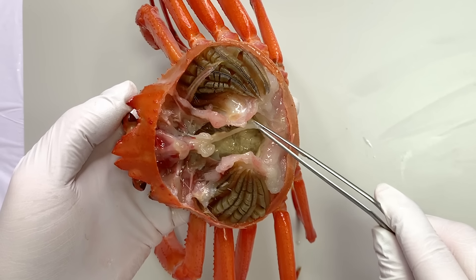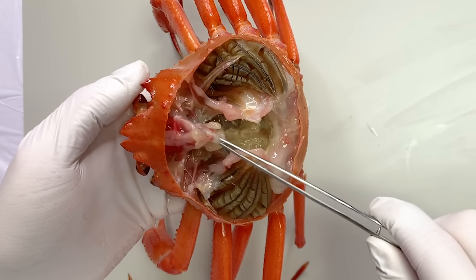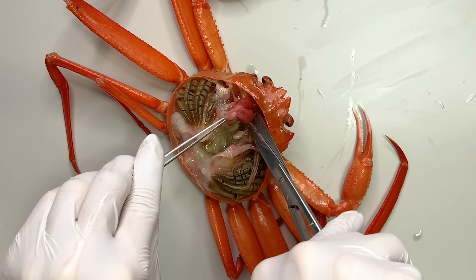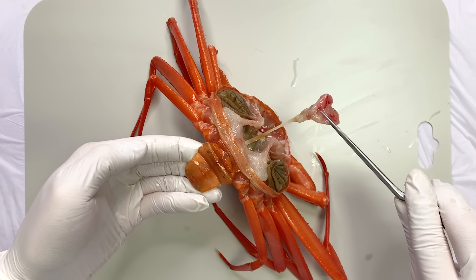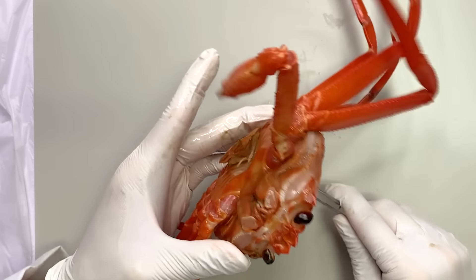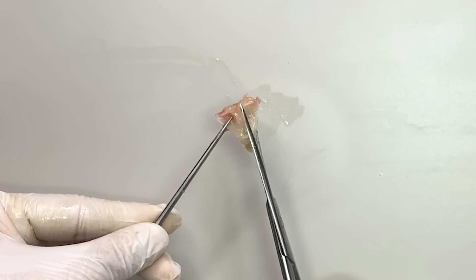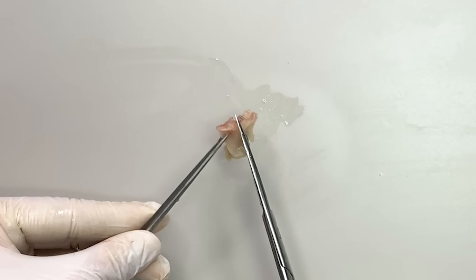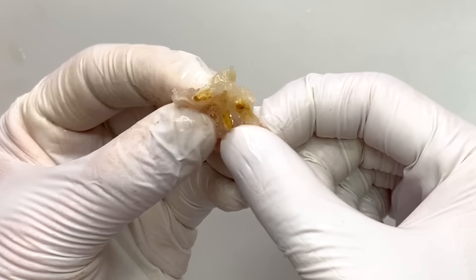This part is the crab's intestines. And this is the crab stomach. If you cut open the stomach, you can see that it continues into the abdomen, extending down to the anus. Additionally, there are strange organs inside the stomach. The crab's stomach contains teeth called gastric mills, which grind up the food that enters the stomach.